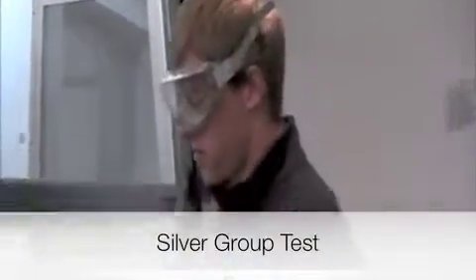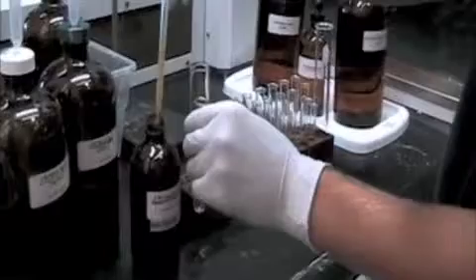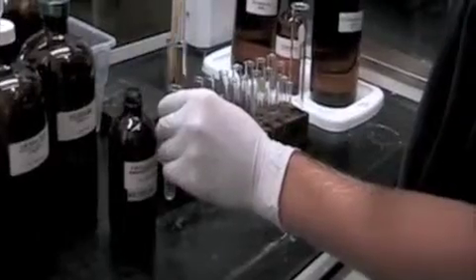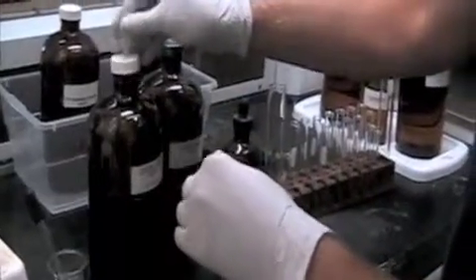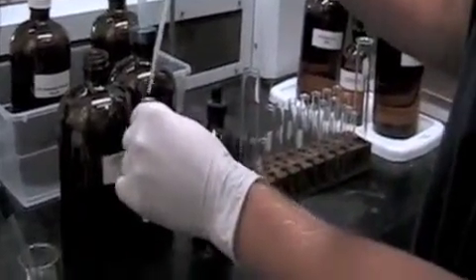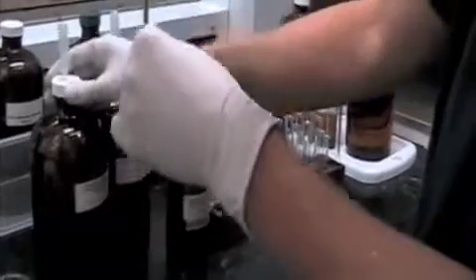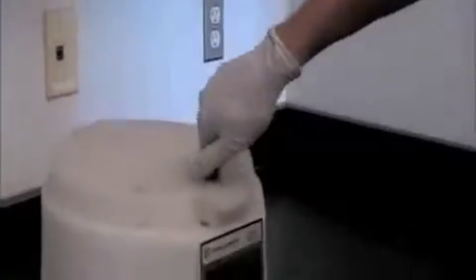What I'm going to show you now is the silver group test. You're going to take five drops of your anion and place it in a test tube. Next you're going to take two drops of silver nitrate — both solutions are already made for you — and bring this solution over to the centrifuge. Make sure that you partner up with a buddy so the centrifuge is balanced correctly, then run it.